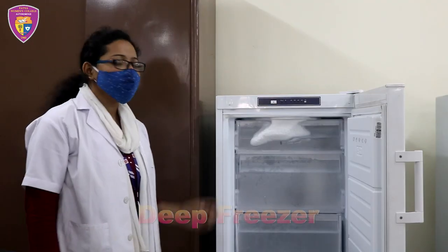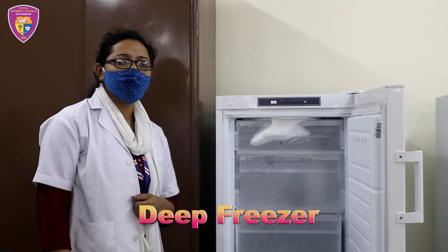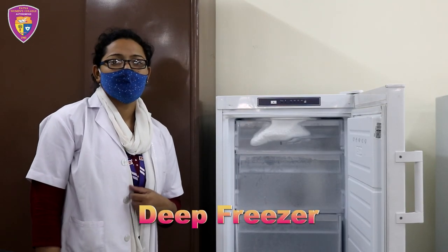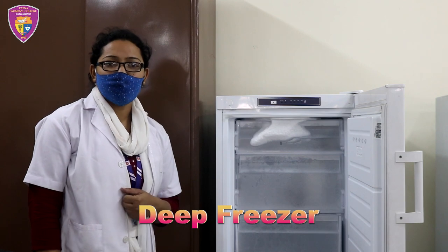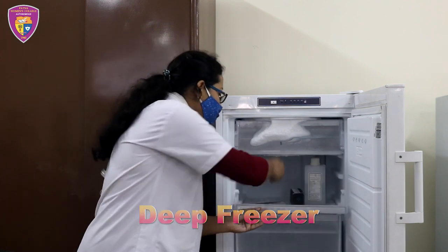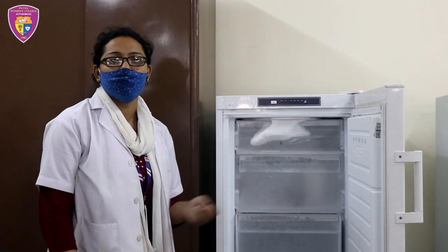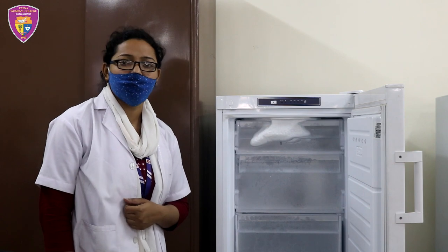This is the deep freezer and it is used to preserve medical reagents and biological samples at a temperature of minus 20 degrees Celsius.